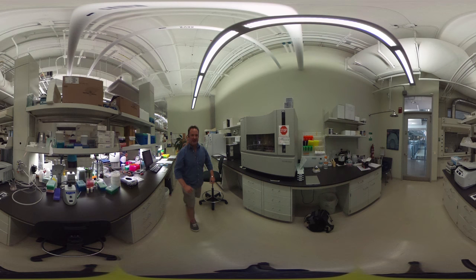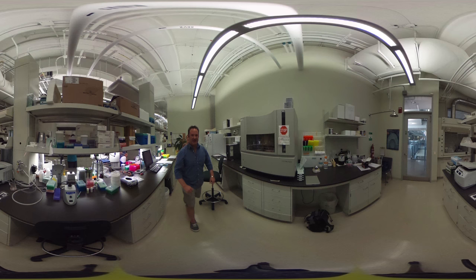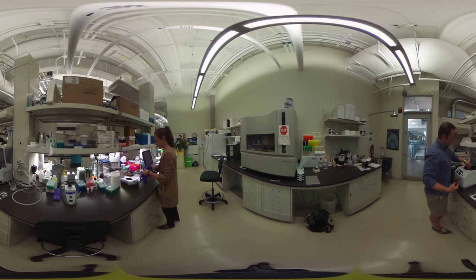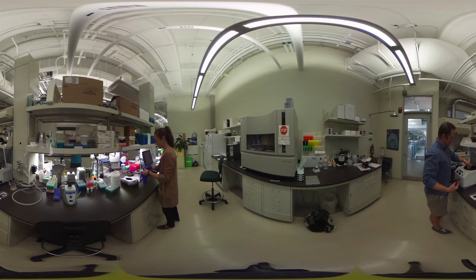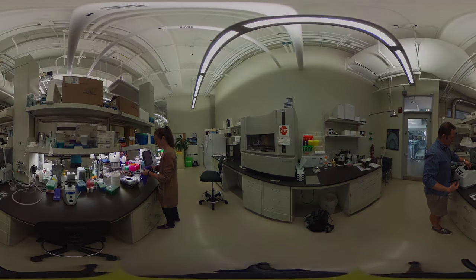Say I do next-gen sequencing and find a region of DNA that's really interesting — one I think is impacting the phenotype I'm seeing. I then go over to the Sanger sequencer and clone that gene or DNA to look at how it functions in different species, or how the gene has changed evolutionarily. So I can examine the exact sequence of that gene rather than just getting a whole lot of information at once.